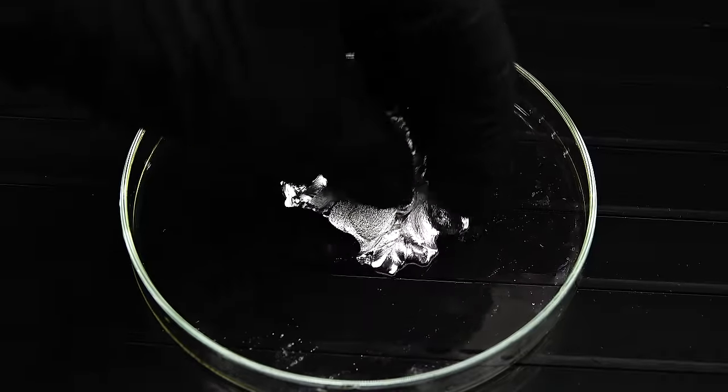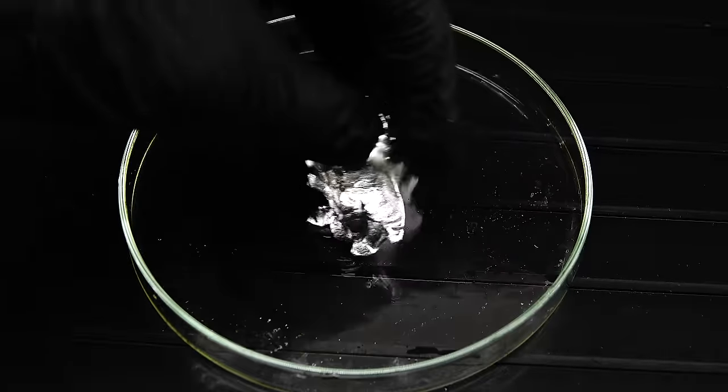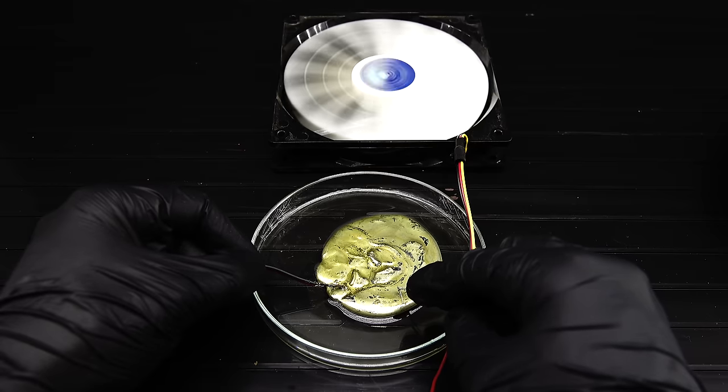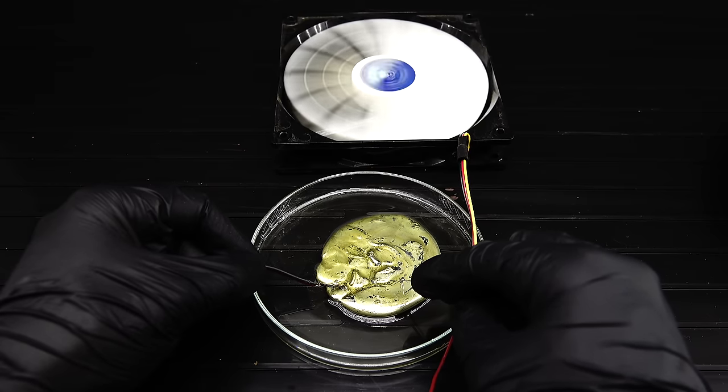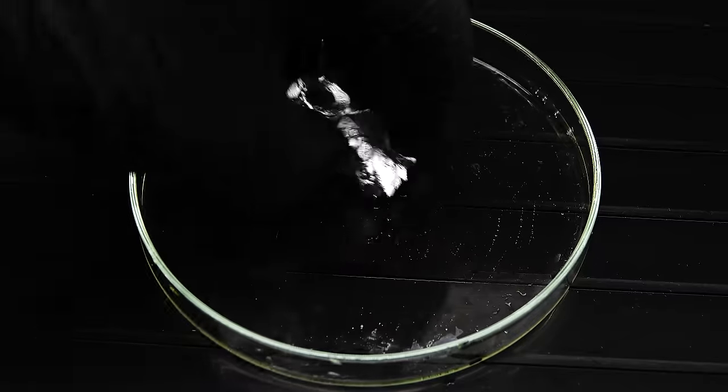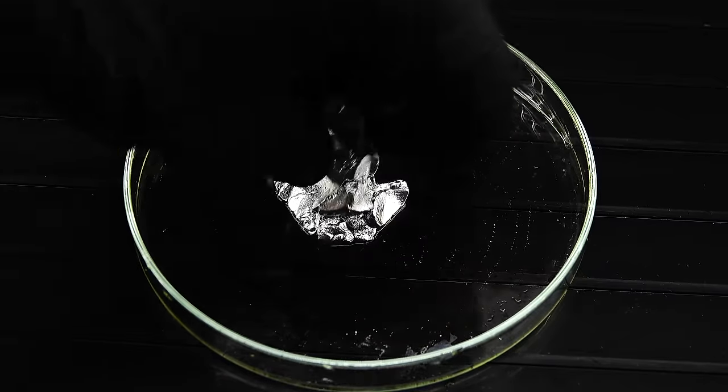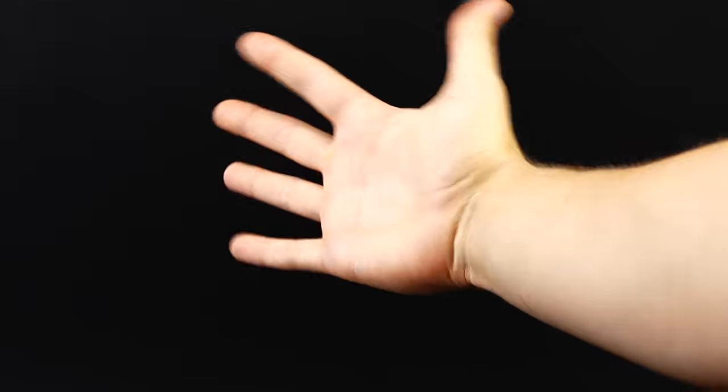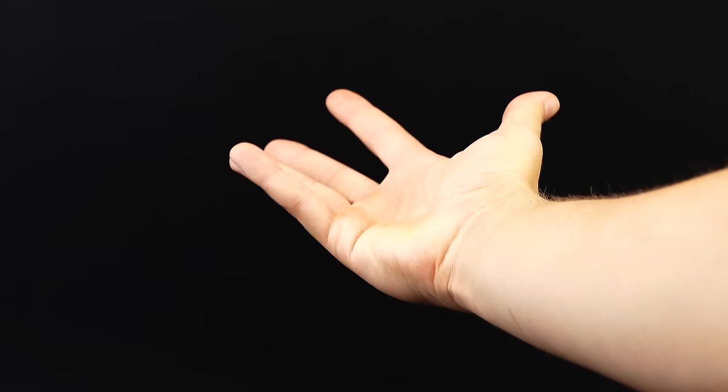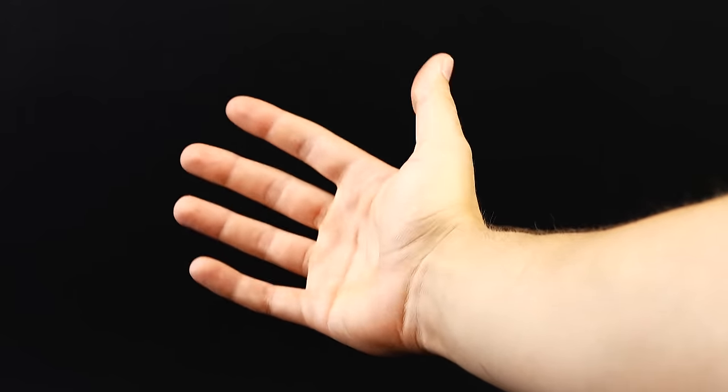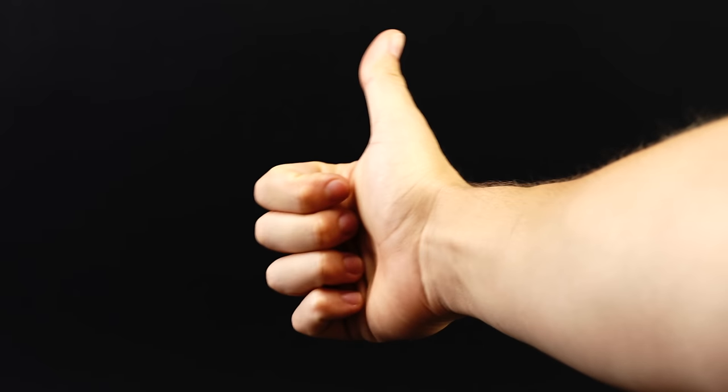Anyway, the last thing I wanted to test was my amalgam's electrical conductivity, which turned out to be the same as mercury's and means that theoretically it could be used as a low-temperature solder for specialized applications. Also, after playing with the amalgam for a while, I cleaned it out enough that I was feeling confident to try and hold it in my bare hand. While this contradicts almost everything I said about mercury's safety, I didn't have any cuts on my hand, and if I later wash it thoroughly, there shouldn't be any problems.